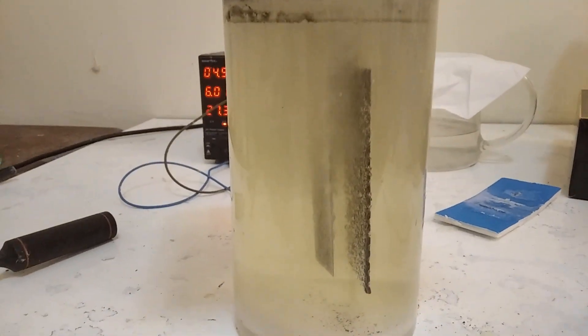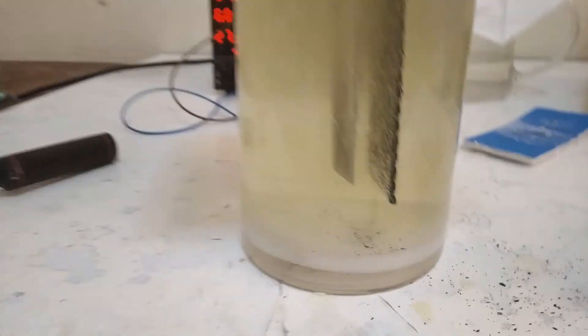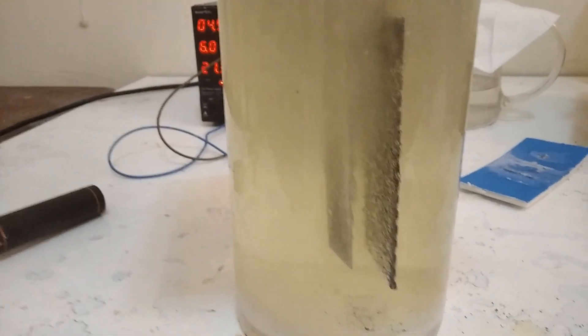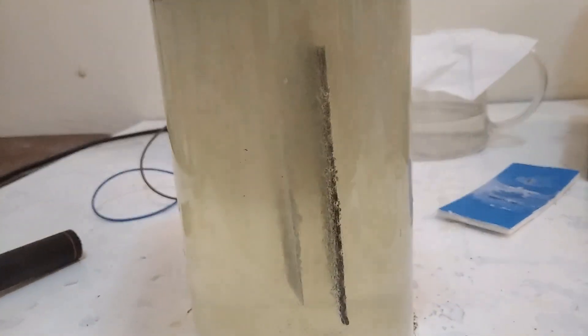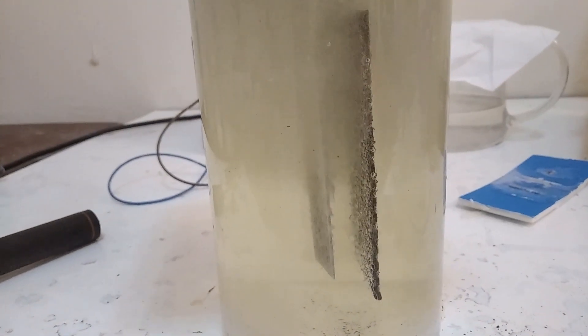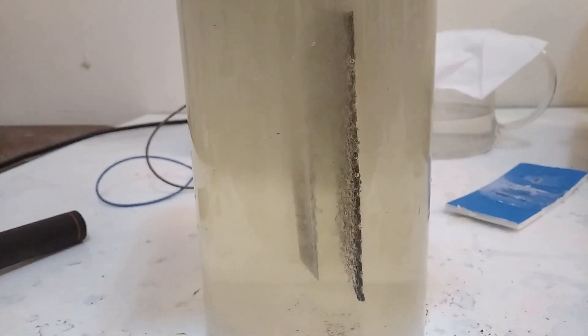So I've changed the electrode, it still seems to be great. I've also added more sodium chloride for a saturated chloride solution and yeah, the erosion is not bad at all.